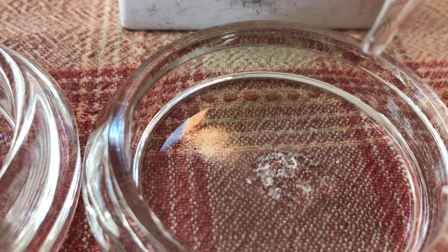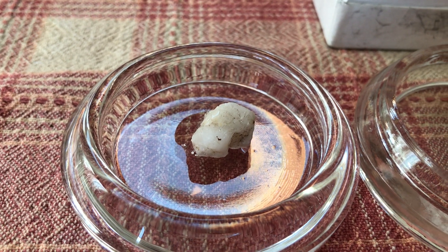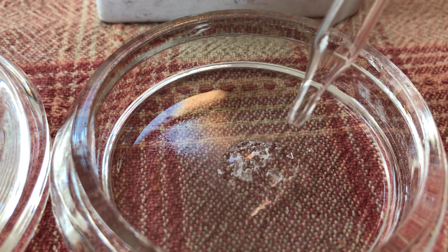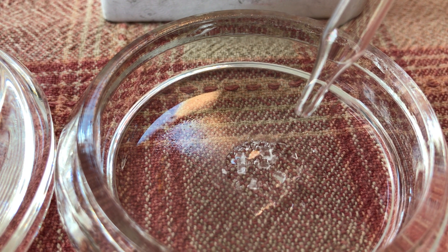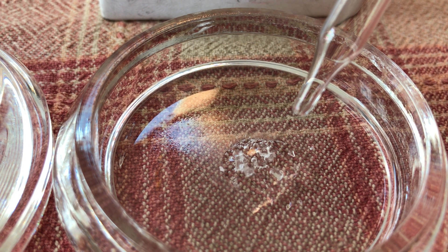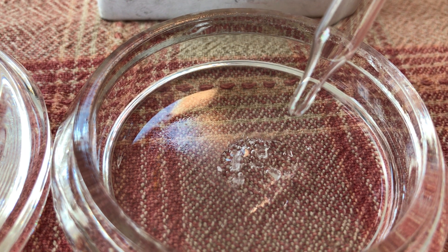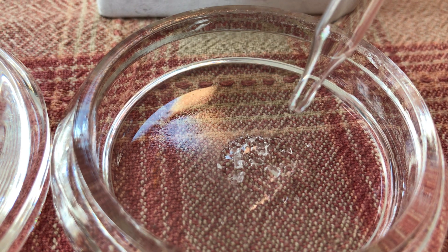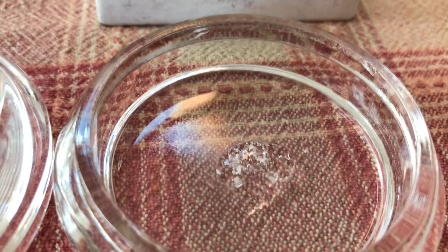So once again: quartz — no bubbles, no reaction. Calcite — we do have that nice gentle bubbling reaction. And this is going to be true of anything that has calcite in it; any sort of soil or other mineral or rock that has calcite will exhibit that bubbling reaction that we see here.